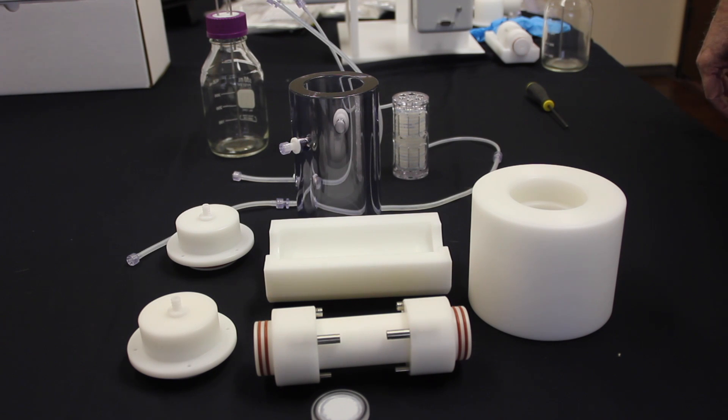So now we've come to the sterilization and autoclaving point of the video. Here we're just showing the large vessel and not the small one just for the sake of screen size so that you can see.